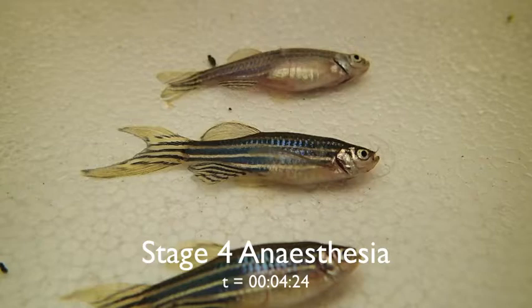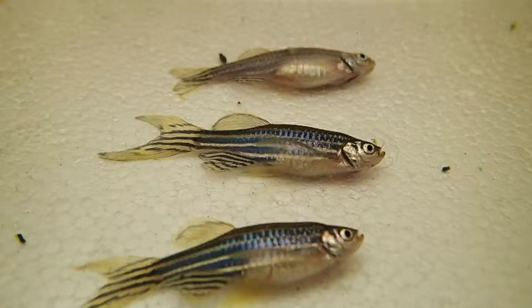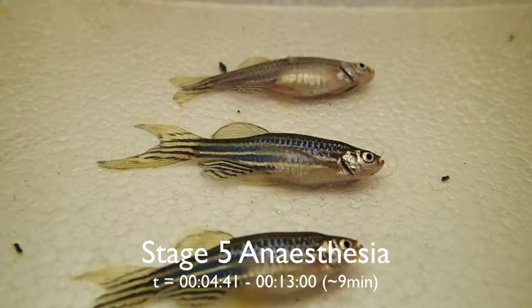Right now all fish are in stage 4 anesthesia. You can tell by applying some pressure onto the tail — you'll see there is no reaction to the slight noxious stimuli being applied.